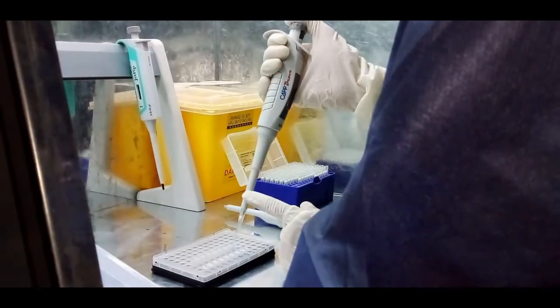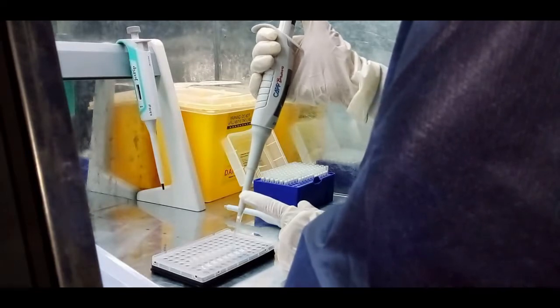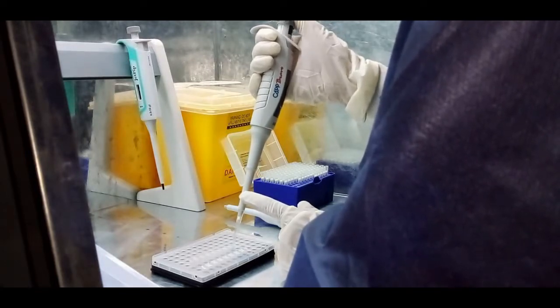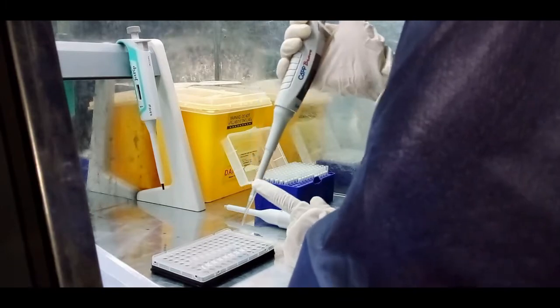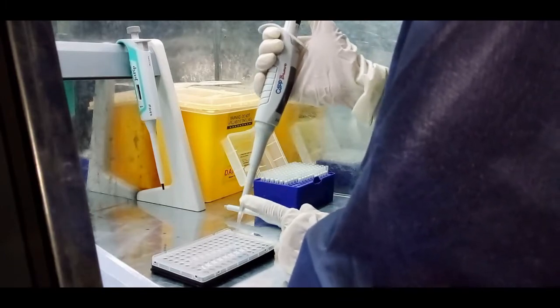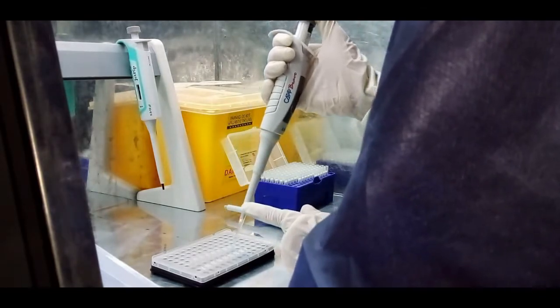Mix the master mix carefully. Then transfer the calculated master mix volume required for only one sample to different tubes.